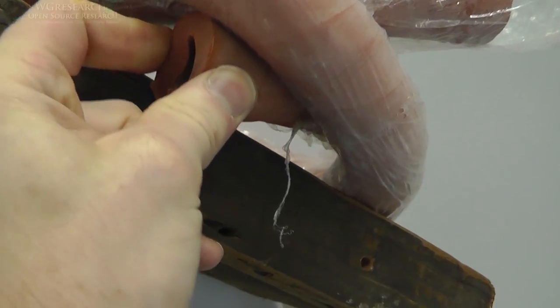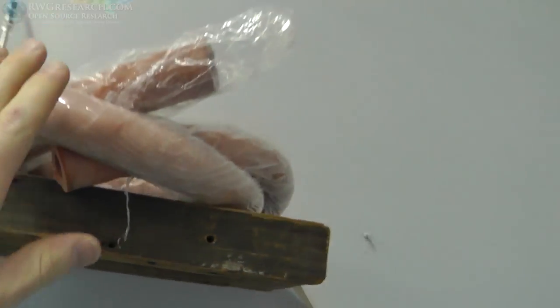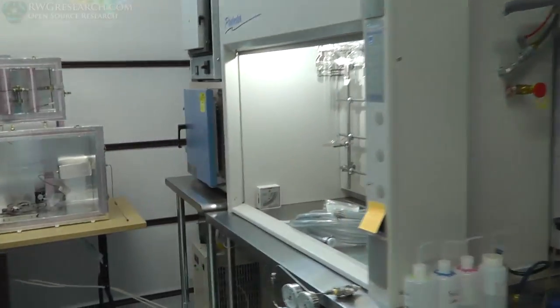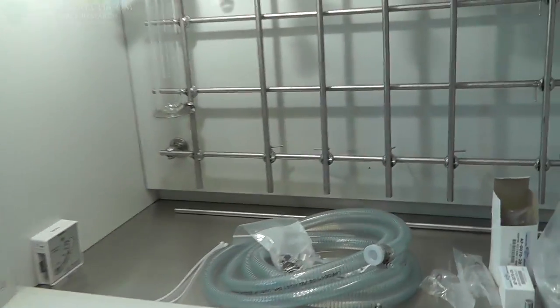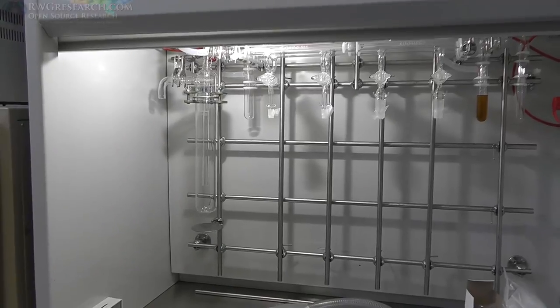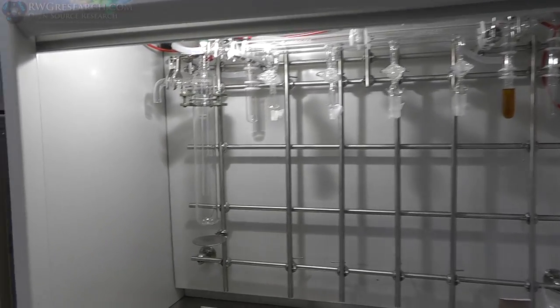This does not have any insert. And I've seen this used on most systems. However, I'm gonna run this hose, I think, all the way back to the line, because it'll actually be a little easier to work with. That rubber hose is really hard to work with. So there you go.